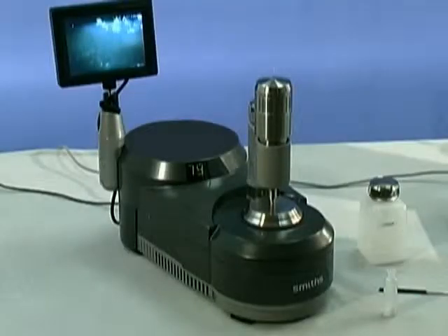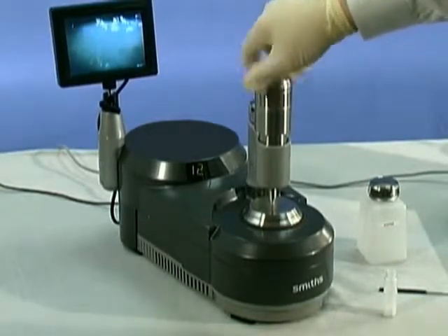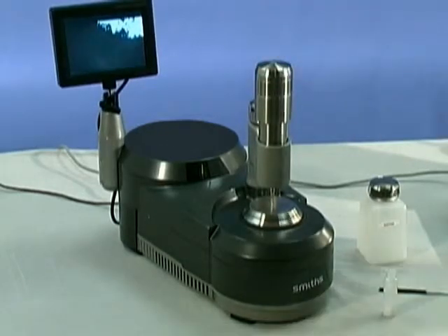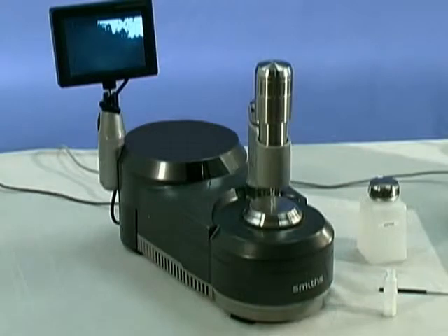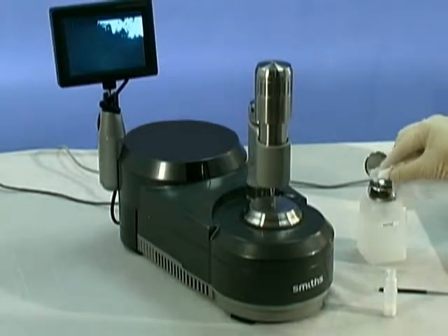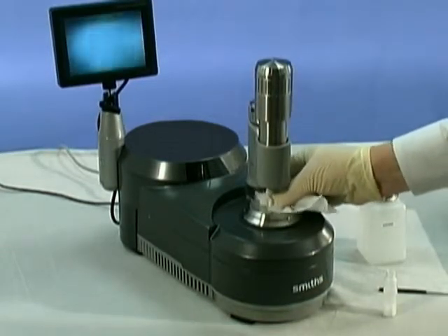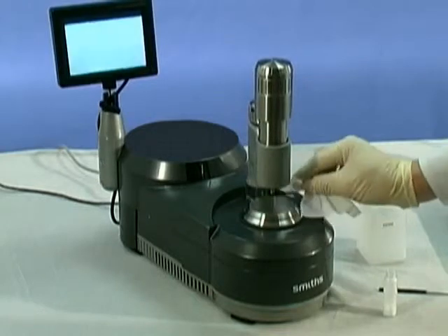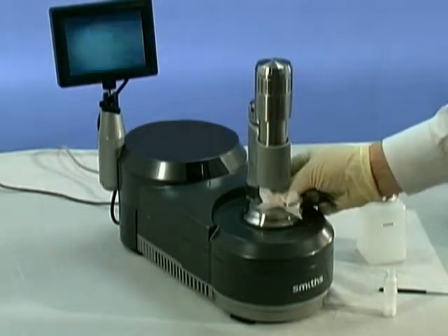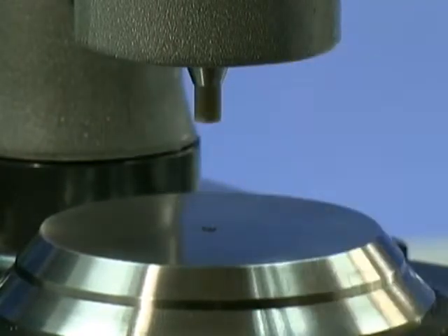To prepare to run the next sample, you release the pressure on the sample press. Then, using a laboratory tissue saturated in solvent, clean off the diamond surface. If you are analyzing solids, you also need to remember to clean the underside of the press tip before analyzing your next sample.